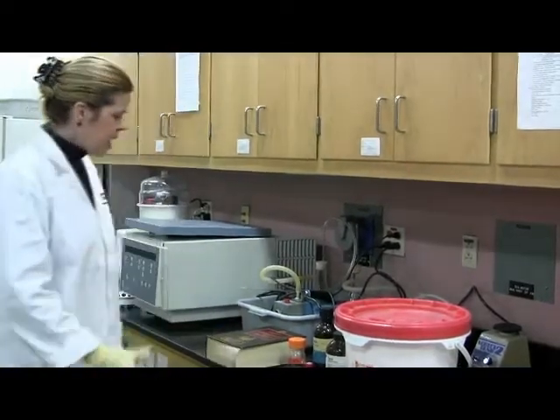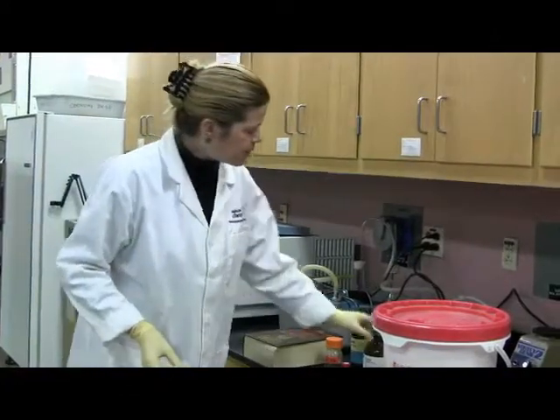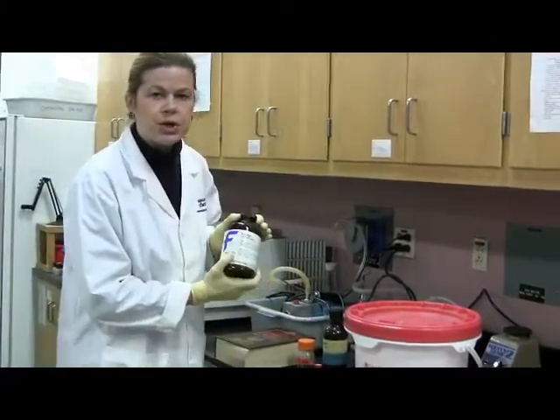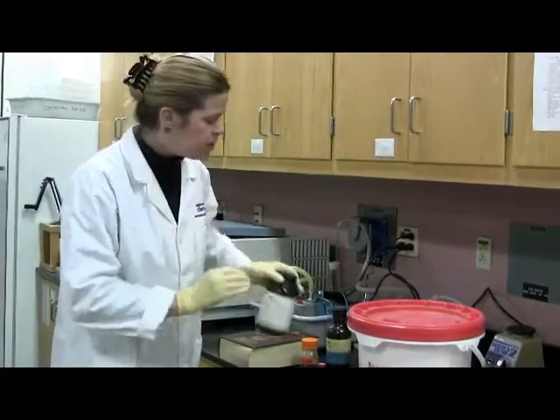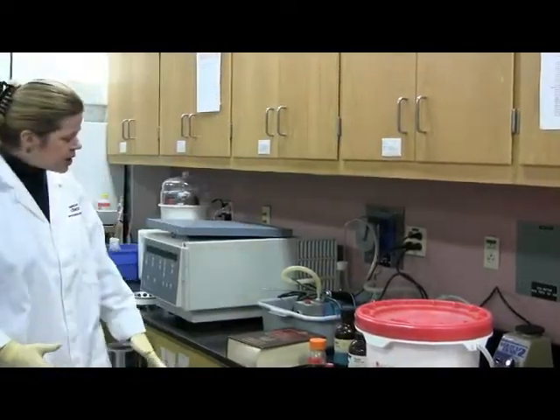Right. Then, once you have that enzyme solution mixed, it's going to be cloudy, and part of that is because this is laboratory grade trypsin, so don't worry about it, just keep going. Okay. Then, you're ready to do your enzyme kinetics.